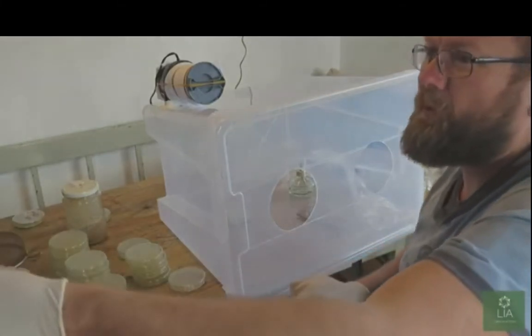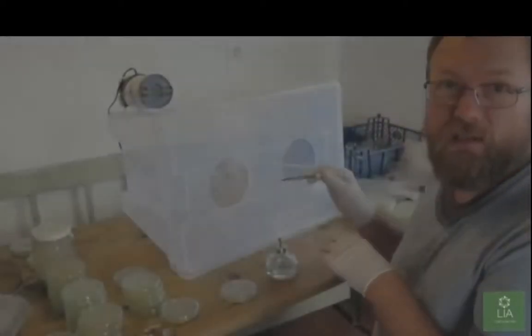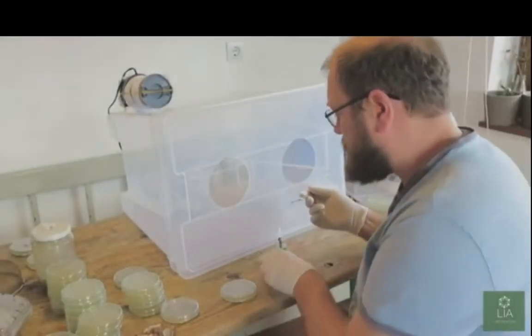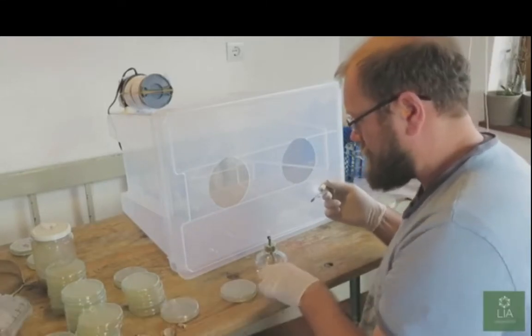So, you just put a base in that. I'm new to all of this. We're going to demonstrate this outside the box because the box makes an awful lot of noise, it would seem. So we're going to go through the process that you would see us doing inside the box.